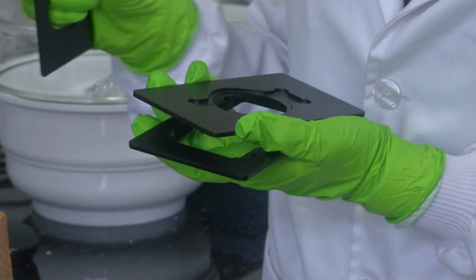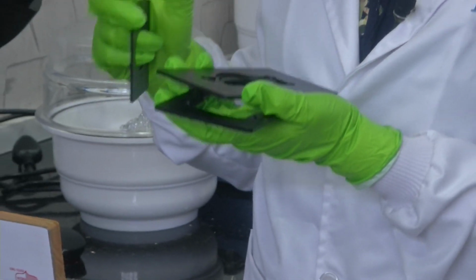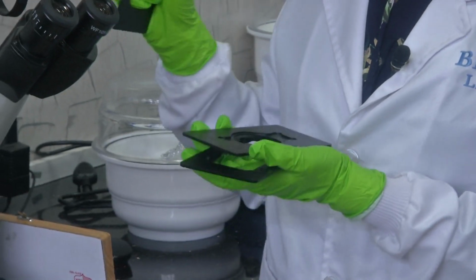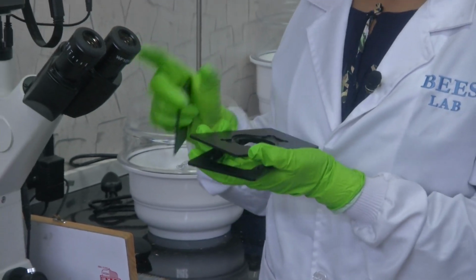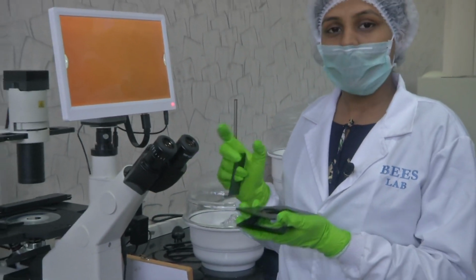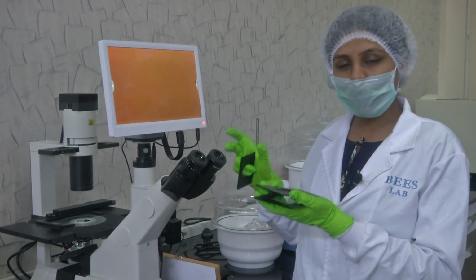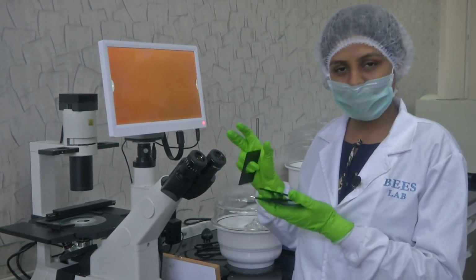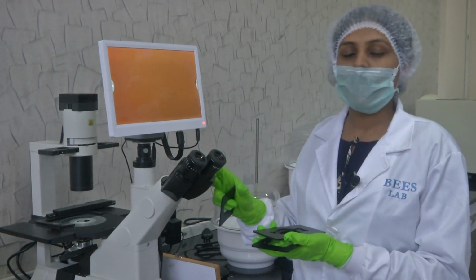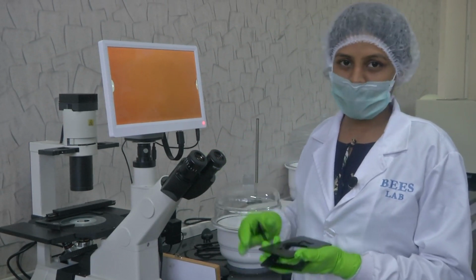All of this is sitting on an anti-vibration table. It is very important for these microscopes, as they are susceptible to vibration, and the readings you see could easily be altered by vibration or other changes. To ensure other parameters do not affect your research or study, all of these are mounted on an anti-vibration table in the facility here.